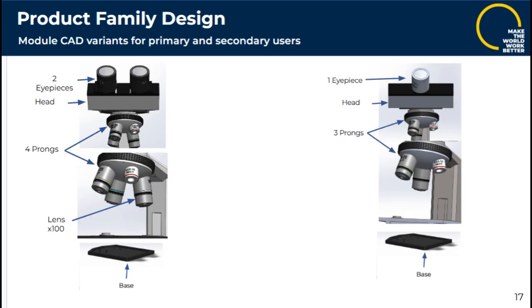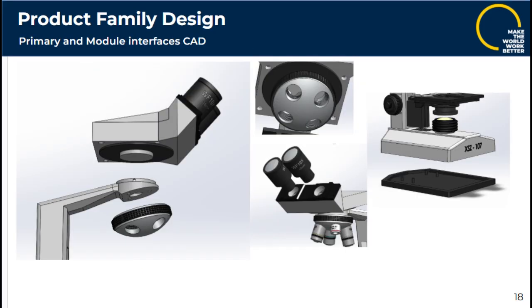In these pictures, you see the CAD visualization of the component designs for the primary users on the left and for the secondary users on the right. In this slide, we see the common interfaces between the platform components and each module component that allow plug-in of modules for the primary product variant.